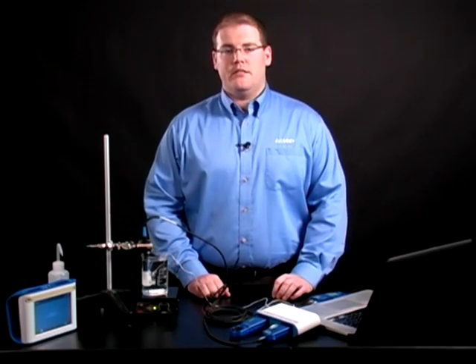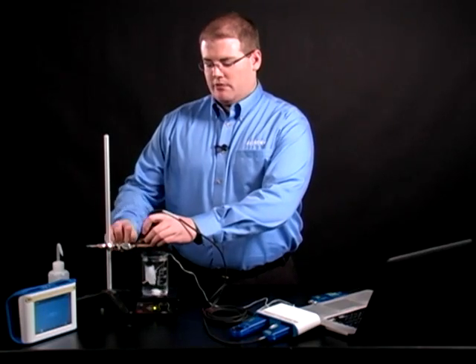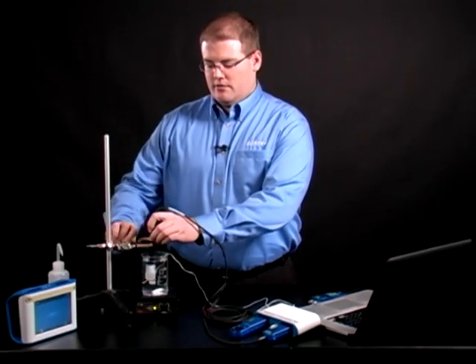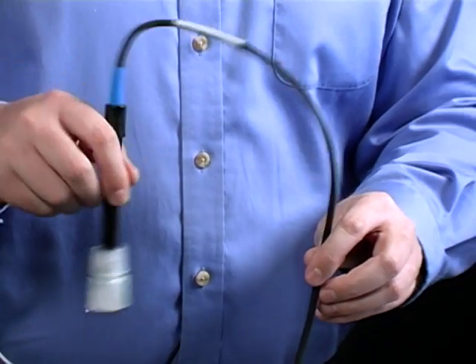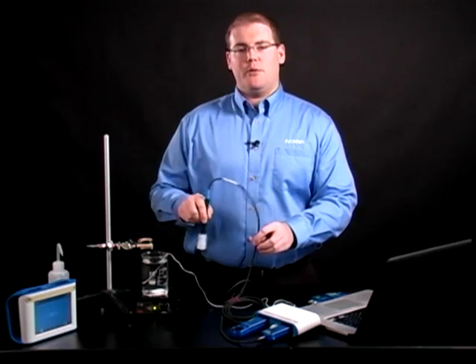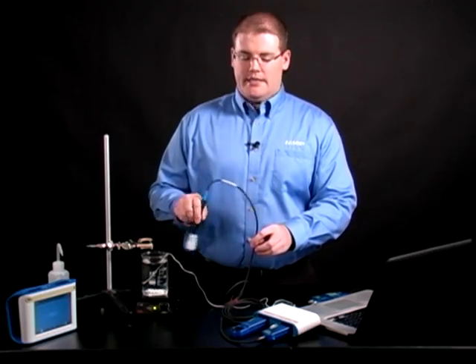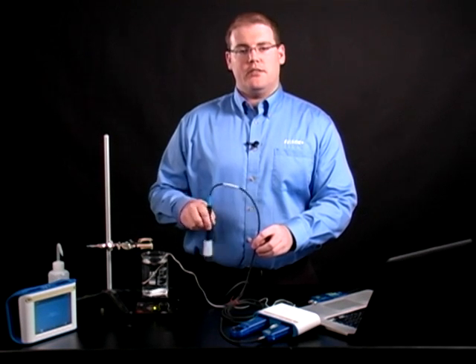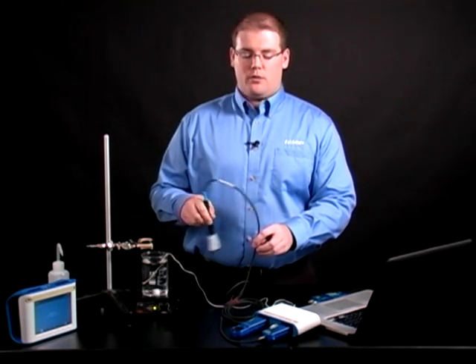After one minute, remove the probe and sample, and shake vigorously for about 30 seconds. We want to create a 100% humidified environment inside of the bottle, which to the sensor is equivalent to oxygen-saturated water.